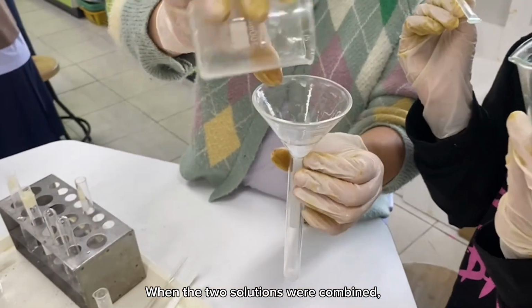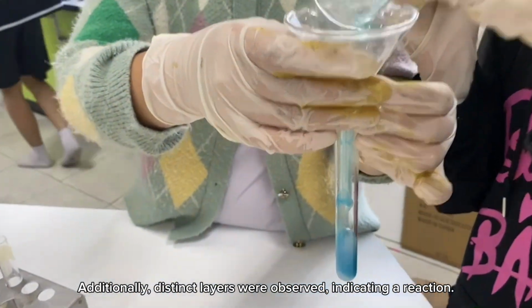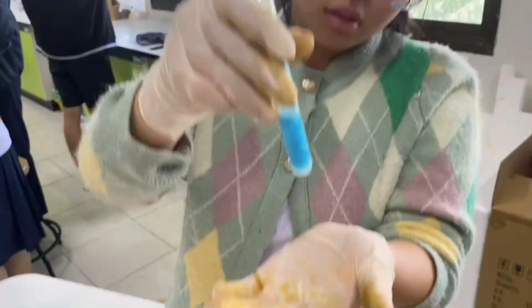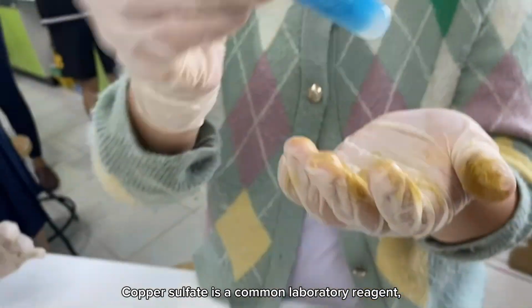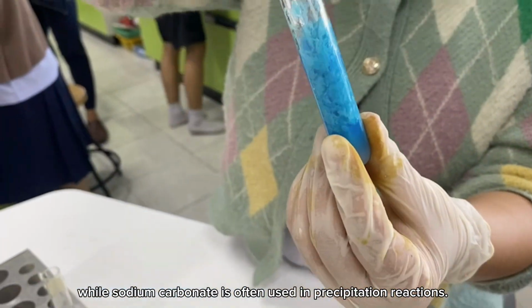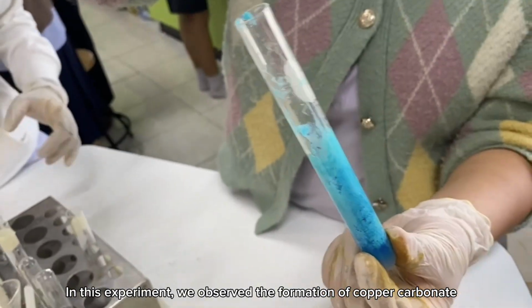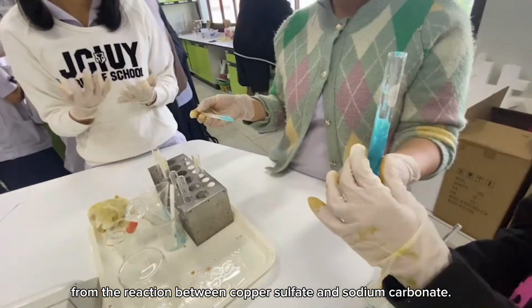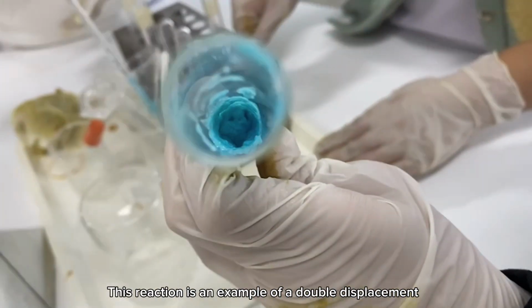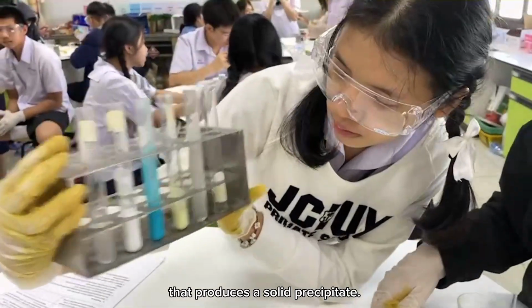When the two solutions were combined, the mixture turned blue and a precipitate formed. Additionally, distinct layers were observed, indicating a reaction. Copper sulfate is a common laboratory reagent, while sodium carbonate is often used in precipitation reactions. In this experiment, we observed the formation of copper carbonate from the reaction between copper sulfate and sodium carbonate. This reaction is an example of a double displacement reaction that produces a solid precipitate.